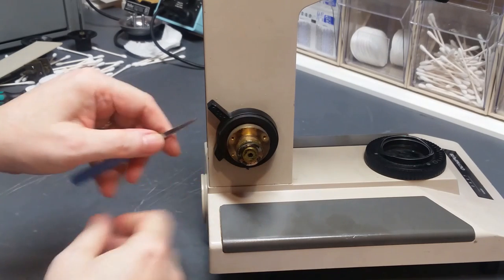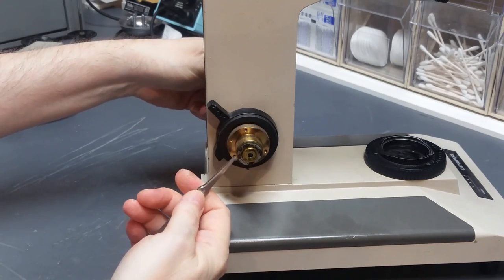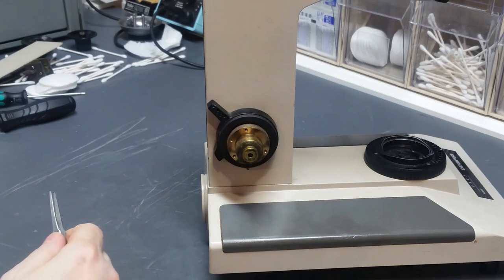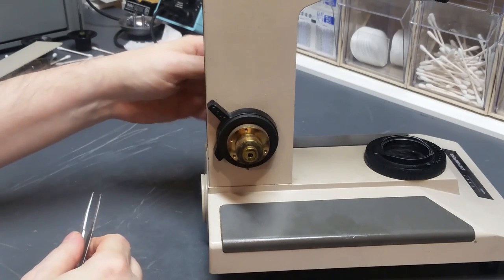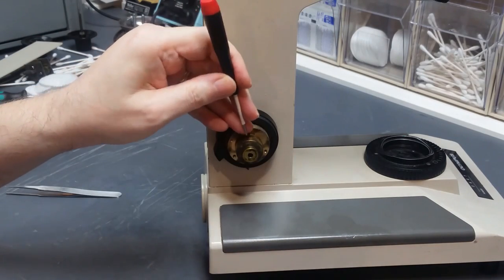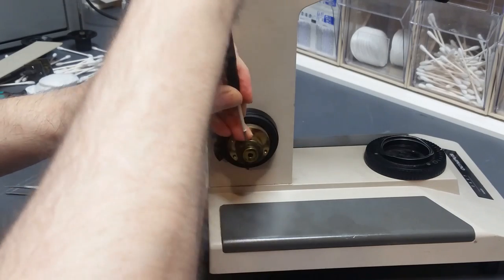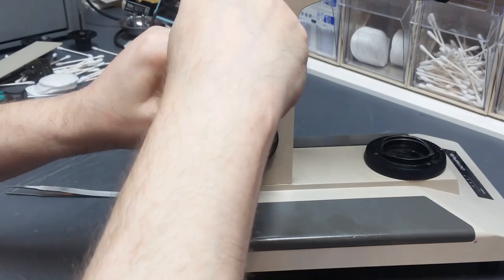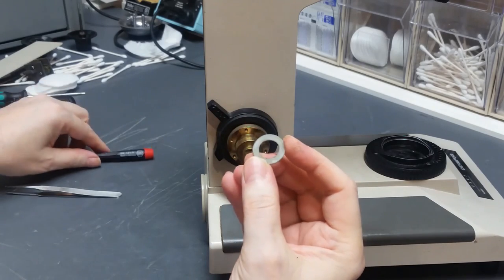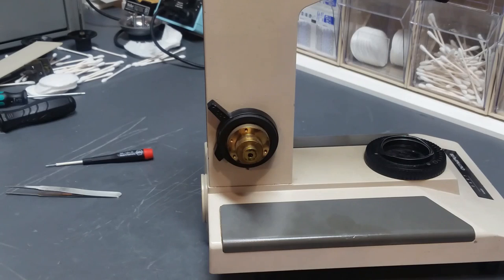And on the end of this brass piece here, there's a spring washer, a wave washer. Take that off. That is filthy. And there is also on here, can't tell it because it's blackened by the old grease, but there is a nylon, I believe it's nylon, thrust washer on here. Take that off there. You can see that it's plastic and not metallic.